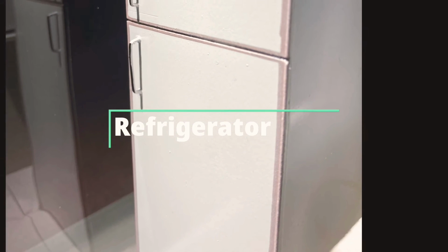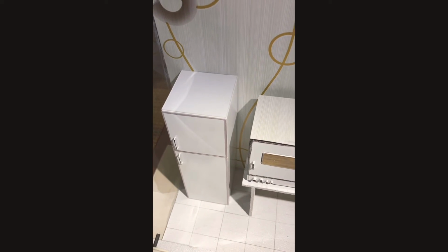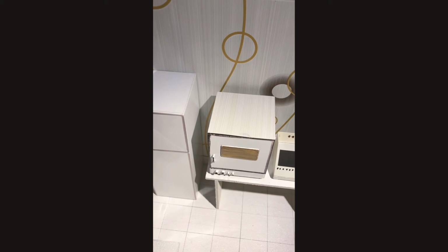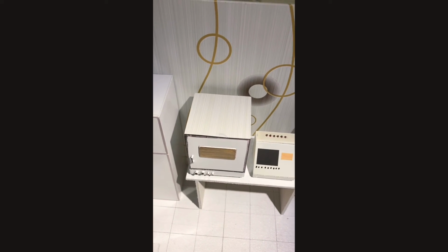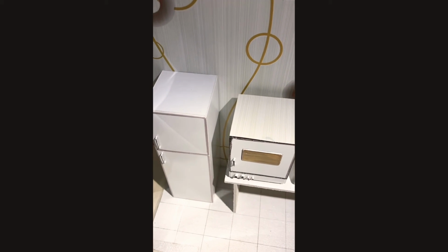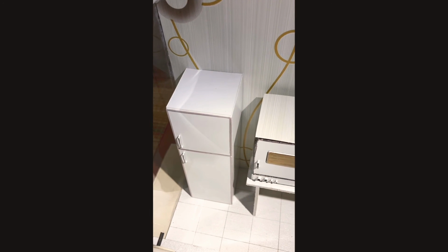Laboratory refrigerators are used to cool samples or specimens for preservation. They include refrigeration units and freezers for storing blood, plasma, and other products such as virus specimens of CSF, outer ear, and unpreserved feces and urine, as well as vaccines and other medical supplies.